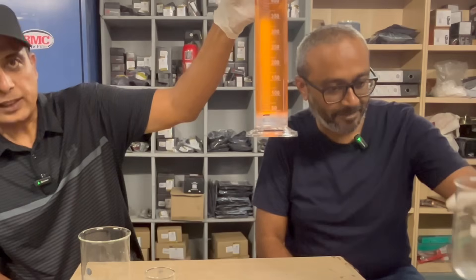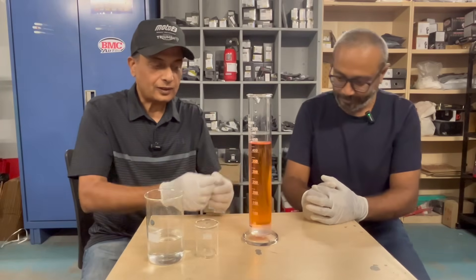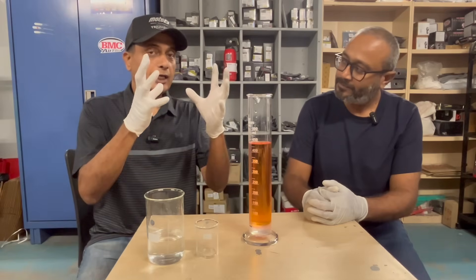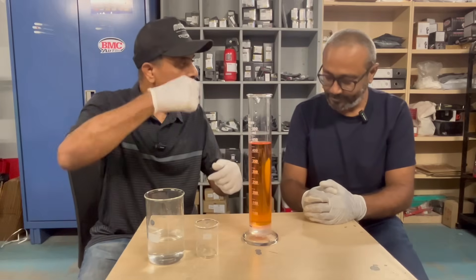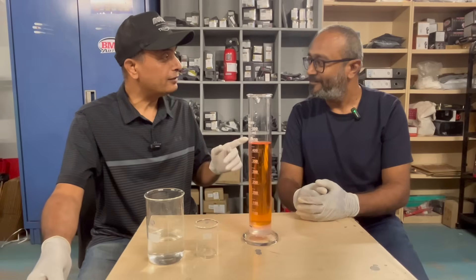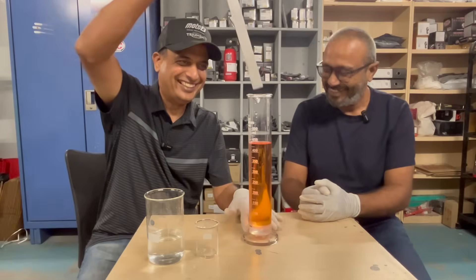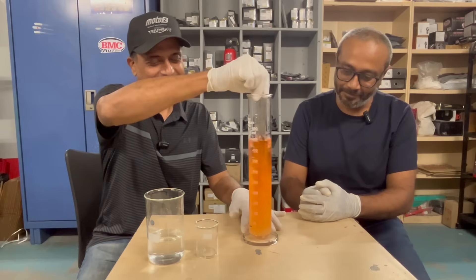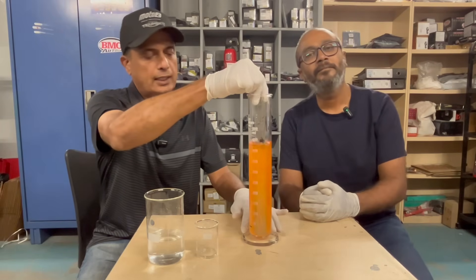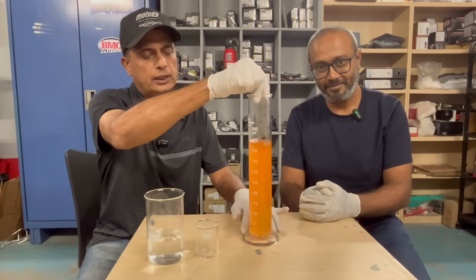So that's the 40 ml of water — you can see it settled right to the bottom, like it actually should. It's now working with the ethanol. However, just leaving it there is not going to get it mixed well. Ethanol is hydrophilic — it's going to attract the water molecules. So what we will do is give it a good shake. Let's give this a good shake. What we are doing is our best to mix the water with this ethanol E10 petrol so that the molecules can bind.